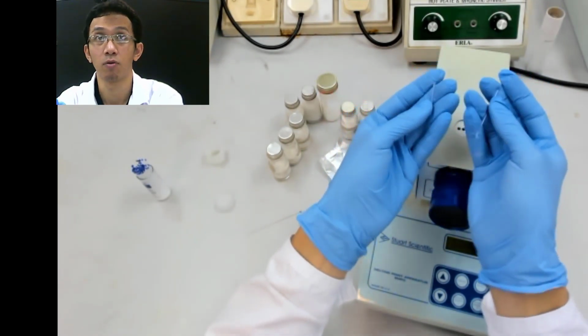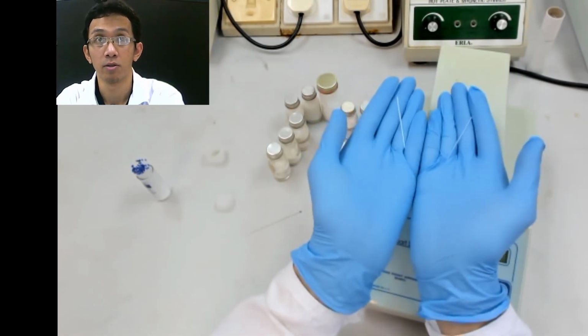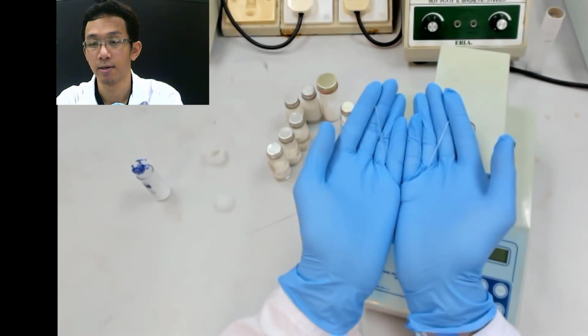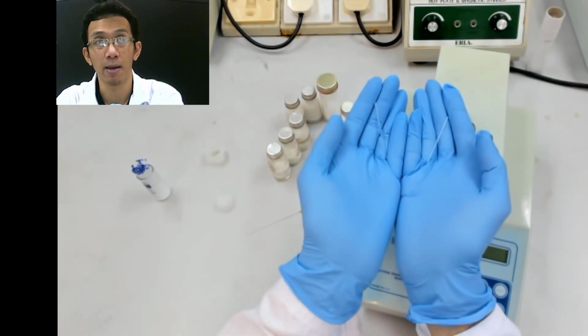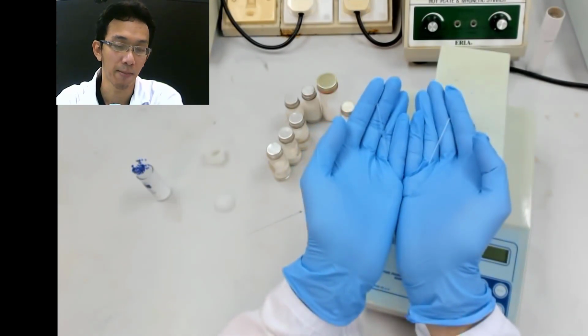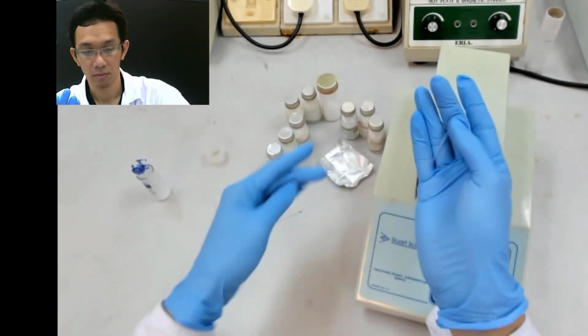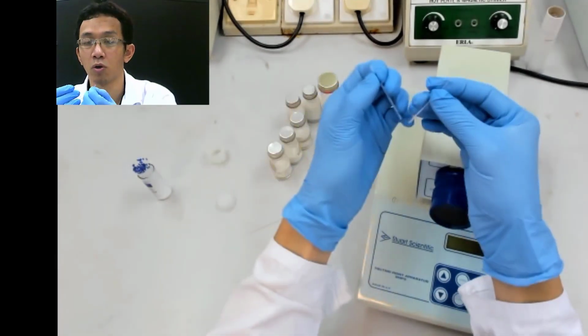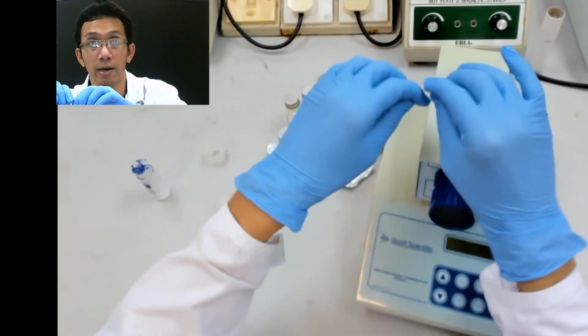So now you have 2 tubes there. I hope you can see that. Okay. So now you want to put your sample, the powder sample, the unknown sample, inside this tube. That is for the both closed end. Both closed end, and then you break.